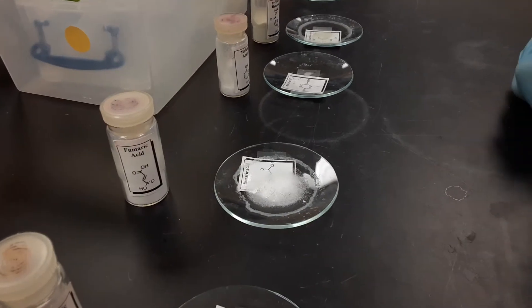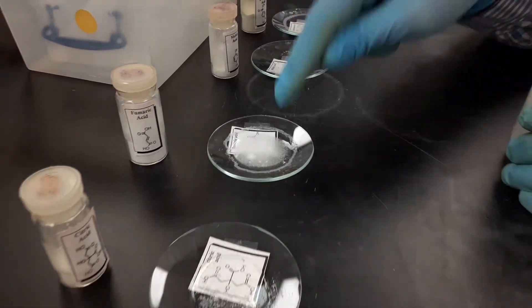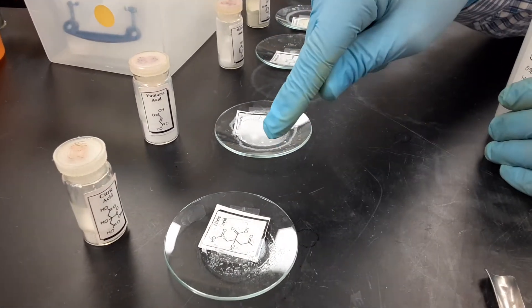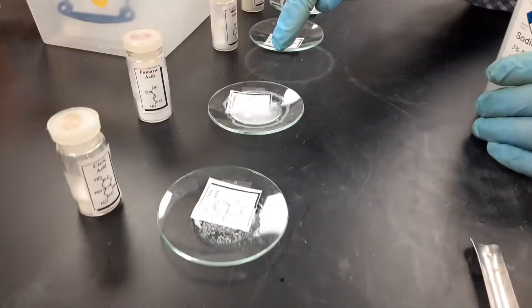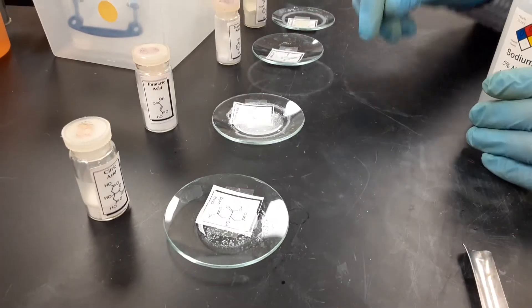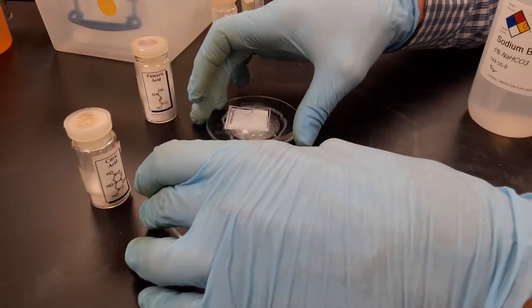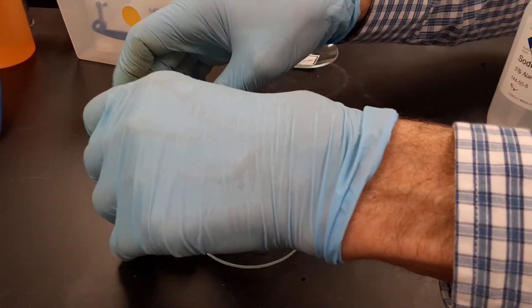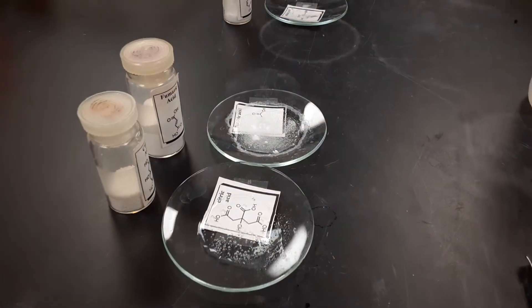If I had to choose which is faster... citric's a little faster, do you agree? They're close though. Let's put them together. I have fumaric maybe a little faster than citric.